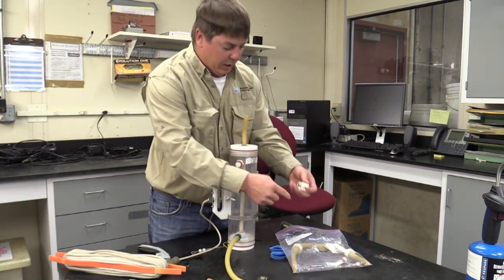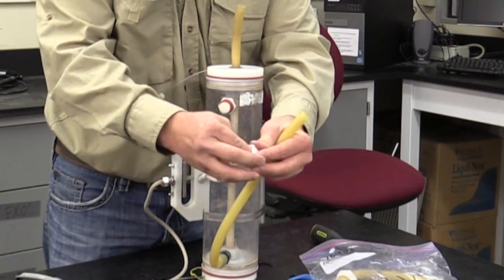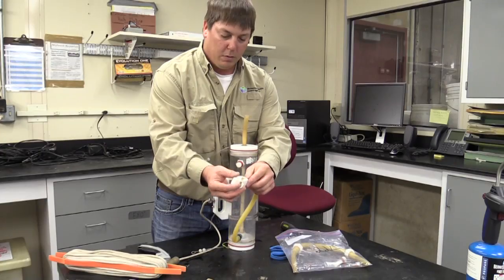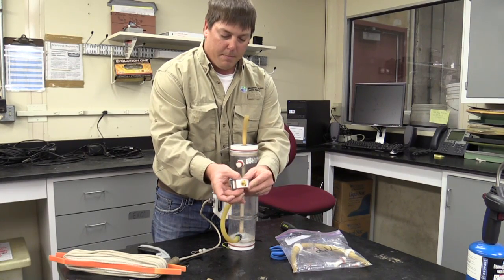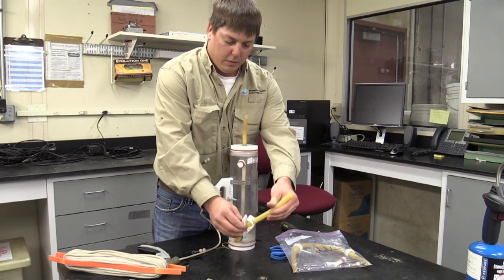The replacement parts kit also comes with a new clamp. These clamps do wear out over the course of time. That just kind of threads on there like so.